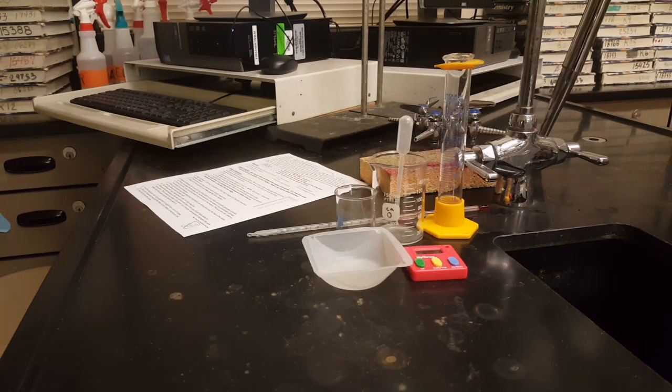Hi you guys, welcome to the Where Did My Aluminum Go lab, and we are going to mix aluminum with copper(II) chloride today and measure a temperature change as the copper ions, which are positively charged cations, they're missing their valence electrons, steal valence electrons from neutrally charged aluminum atoms.